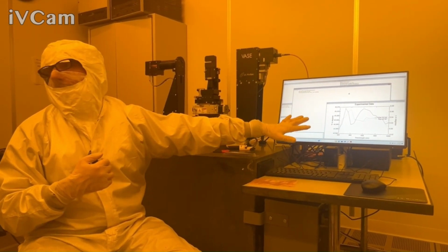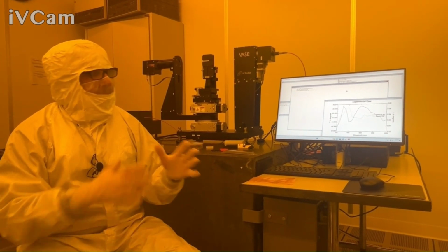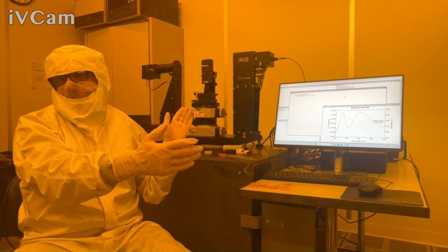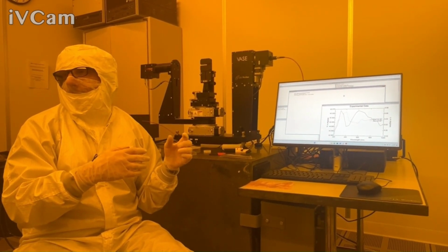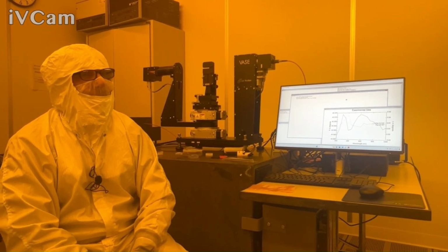But in this case, I definitely need to use the auto retarder because delta is at 0. Okay. So again, I'm always in kind of a research instrument mode. I'm doing the most I can with it, versus if I was doing 20 samples a day, then what's the bare minimum I need to get the answer I want, right?